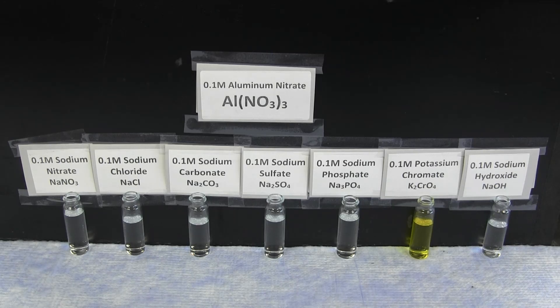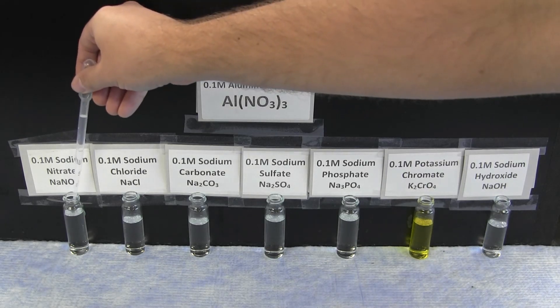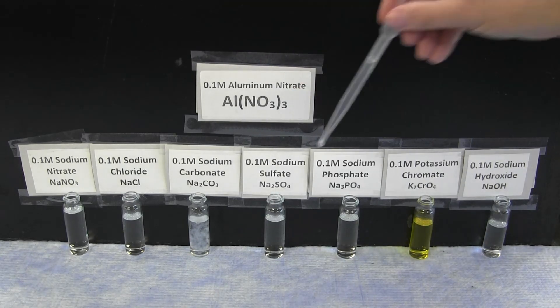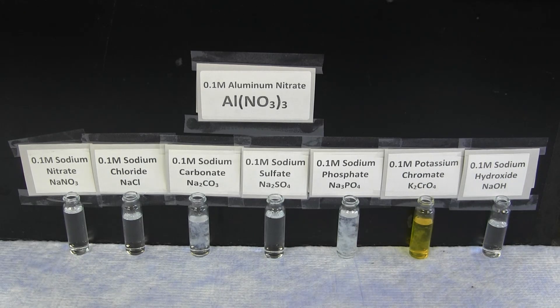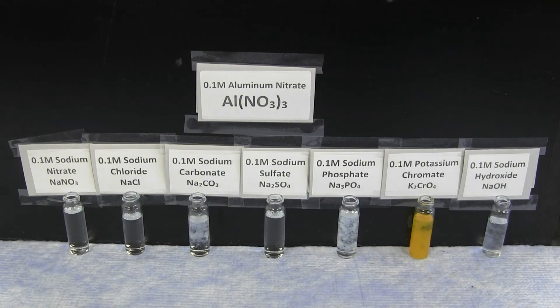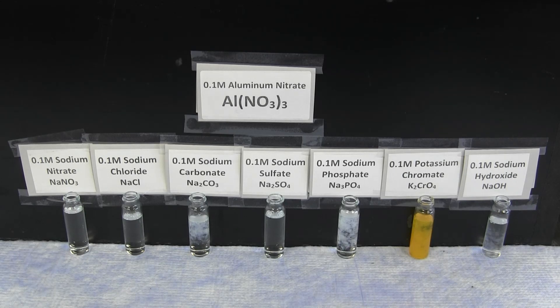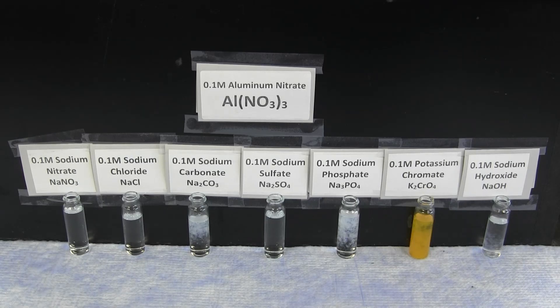The first reaction is with aluminum nitrate, looking at the reactivity of the aluminum ion. Overall, the aluminum ion forms a white precipitate with sodium carbonate, sodium phosphate, and a slight precipitate with sodium hydroxide. It also forms a golden precipitate with potassium chromate.